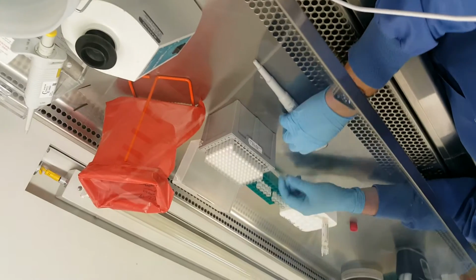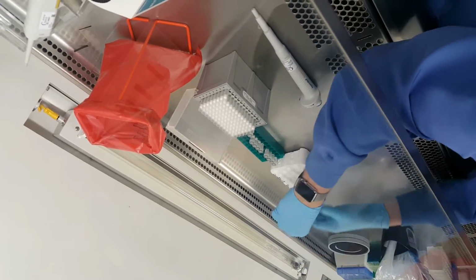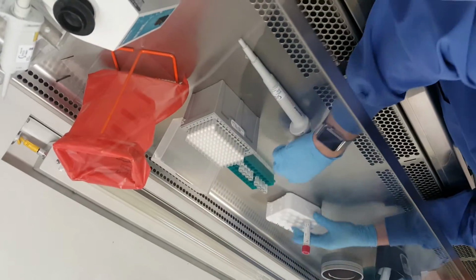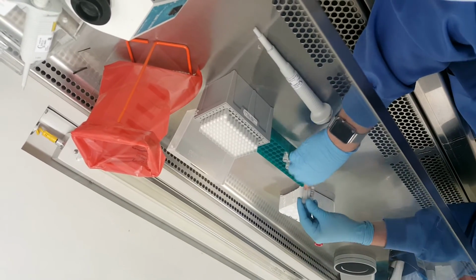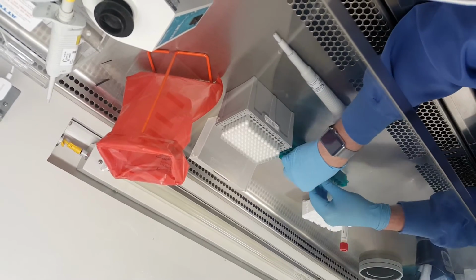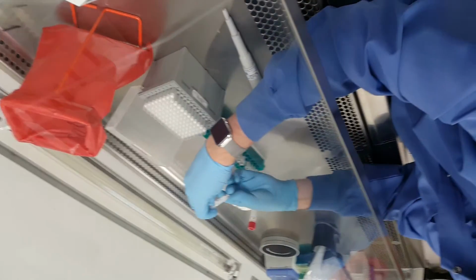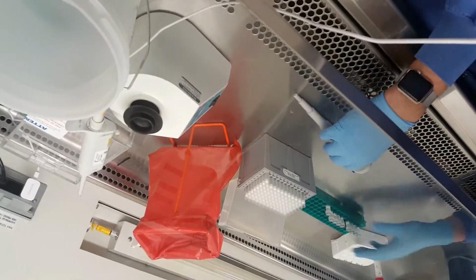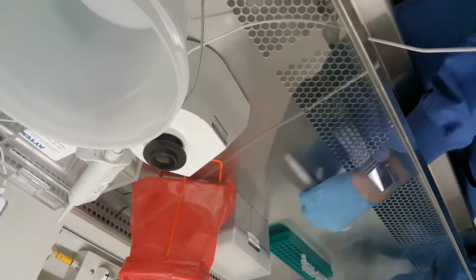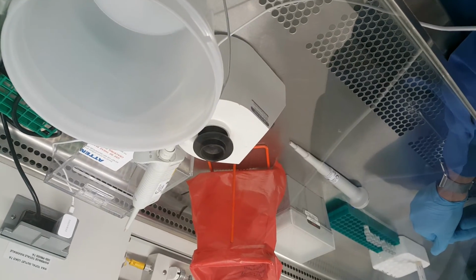What he'll do is just do a quick visual examination of the tubes. The 600 should all look to be about the same. The 250 should all look to be about the same. And then number 9, it's just the residual. So good, good, good, good, good, good, and then the residual. At this point, you record the ending time. We are about 15 minutes past the hour now, so I record that on my sheet. That would be 4:15 p.m.